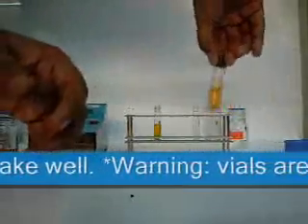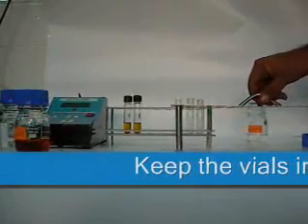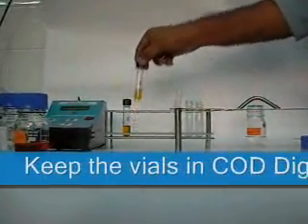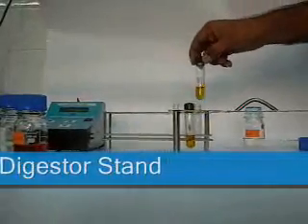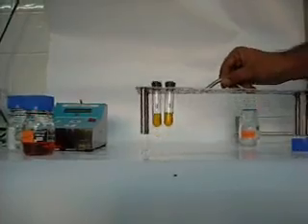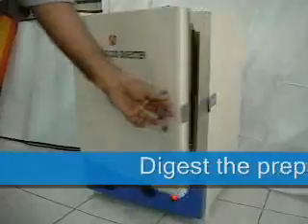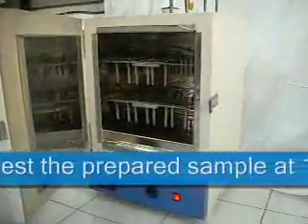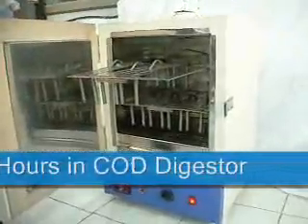Warning: vials are hot. Keep the vials in the COD digester's tank. Second step: digestion. Digest the prepared sample at 150 degrees Celsius for 2 hours in the COD digester.